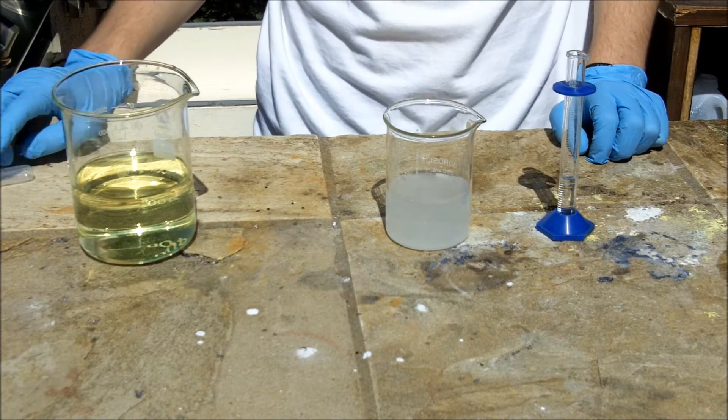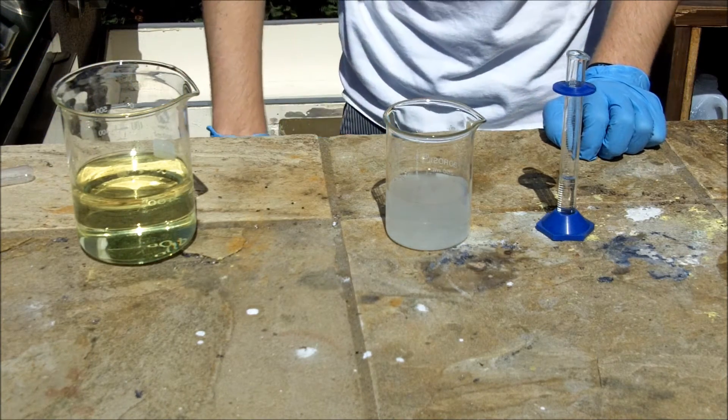Anyway, once that's all dissolved you're going to add 4 milliliters of acetone.